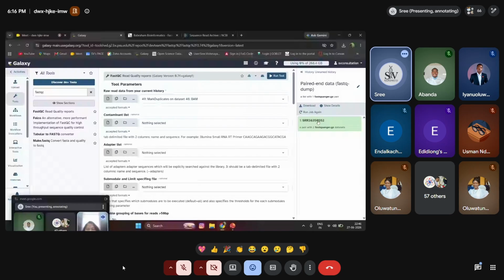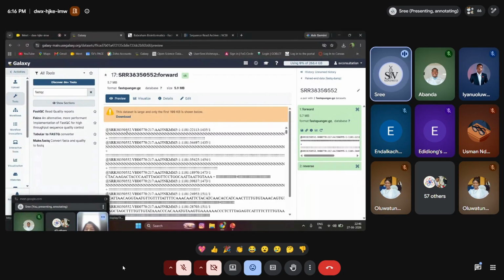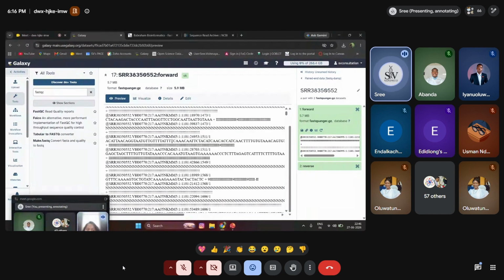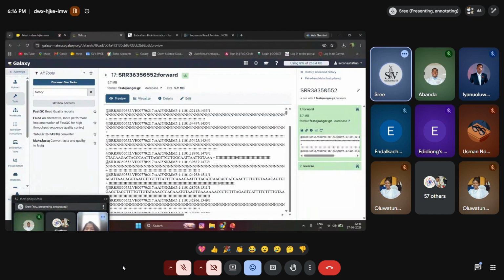If you want to see information like this, I have used this data for example. So what is the accession number? All that information is highlighted over here. In the previous section, you can see the FastQ file. This is a large file, more than 100 kb. You can get the information of everything highlighted here.